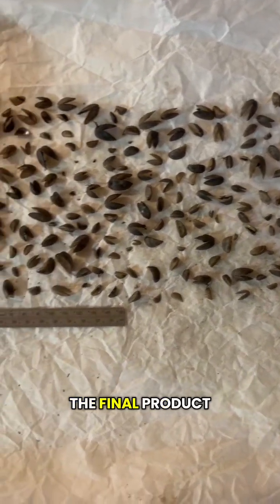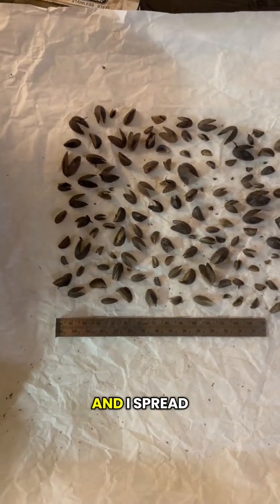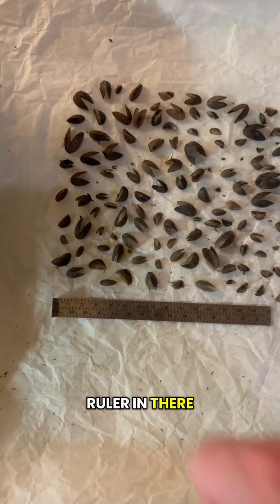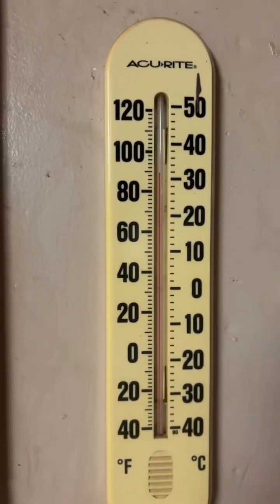So this is the final product. I just try to make sure that the shells are not touching each other, and I spread them out as evenly as I can. And then I put this little ruler in there to help me measure on the computer. So I will take you there now.